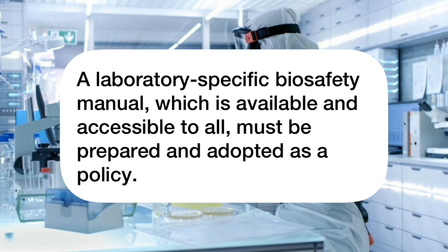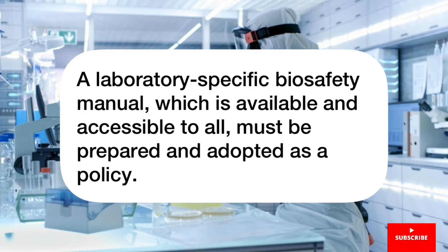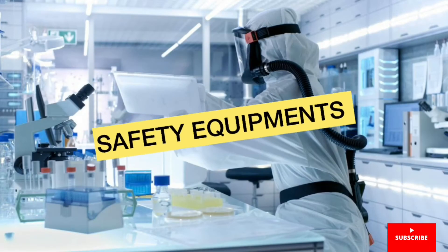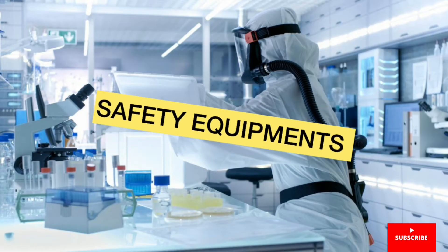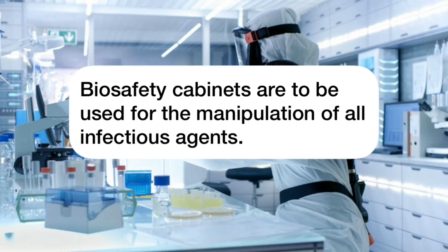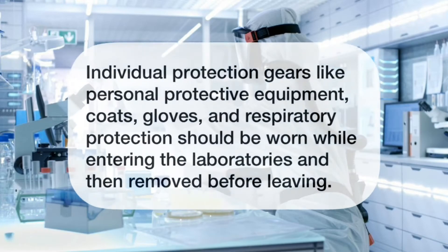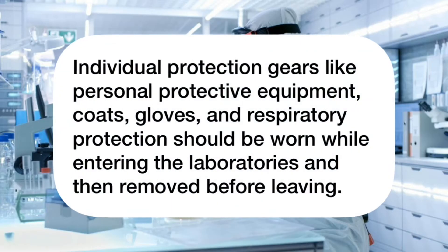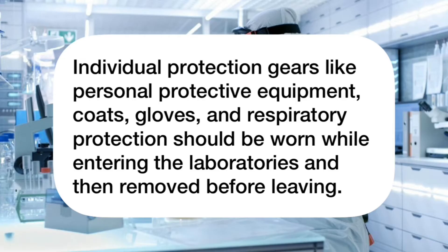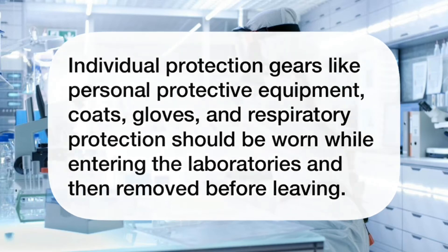A laboratory-specific Biosafety Manual, which is available and accessible to all, must be prepared and adopted as a policy. Safety equipment required includes biosafety cabinets for the manipulation of all infectious agents. Individual protection gear like personal protective equipment, coats, gloves, and respiratory protection should be worn while entering the laboratories and then removed before leaving.